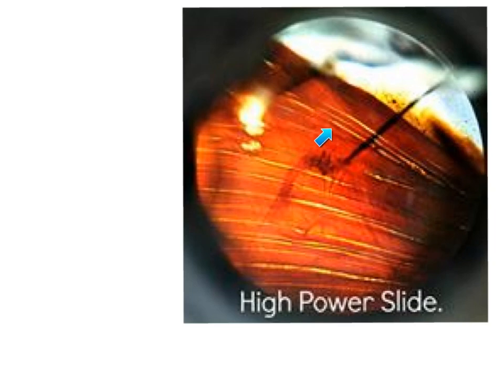As we see, these are the longitudinal sections of the skeletal muscle fibers. These parallel ribbons are the skeletal muscle fibers parallel to each other. And then we have the motor nerve coming to this muscle, supplying it.